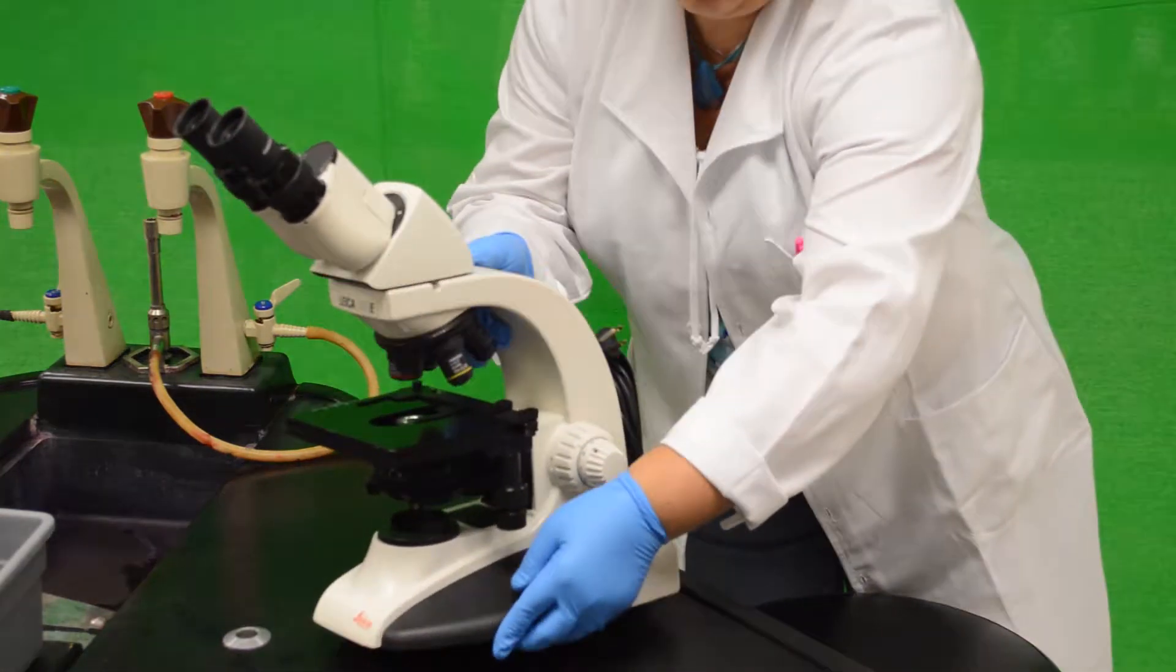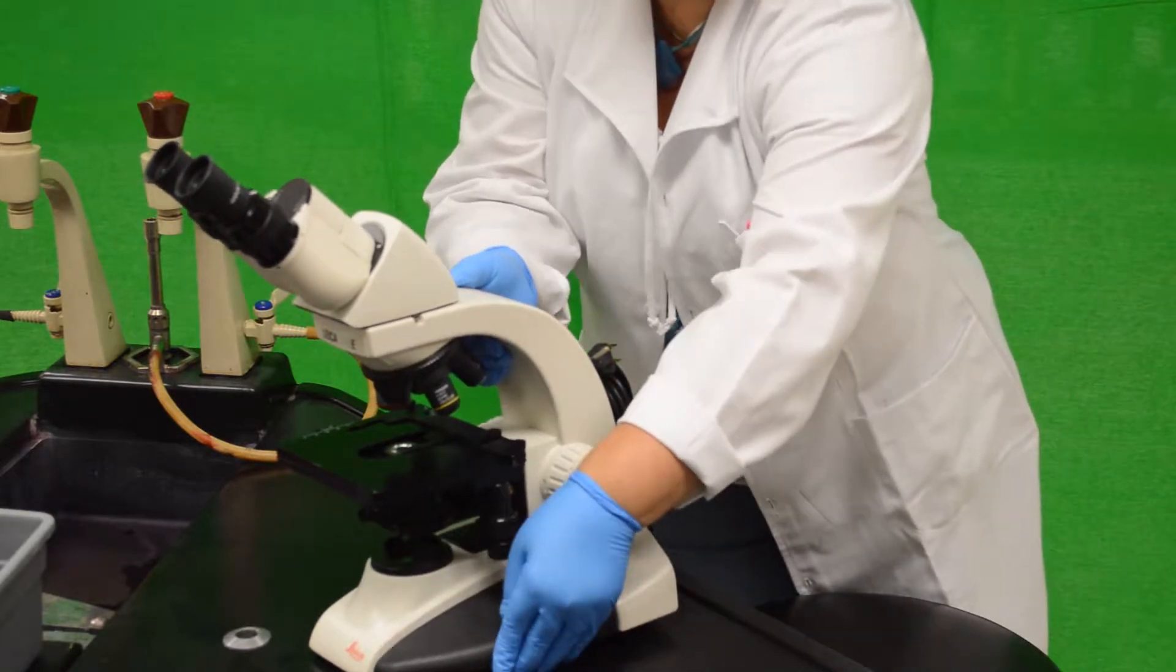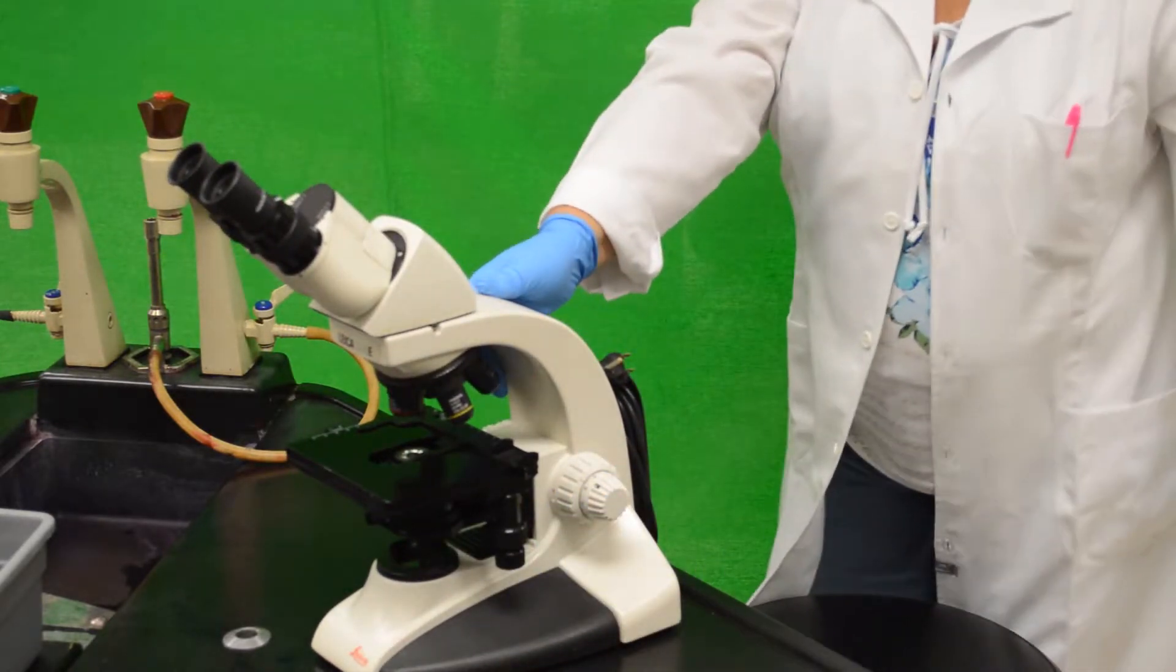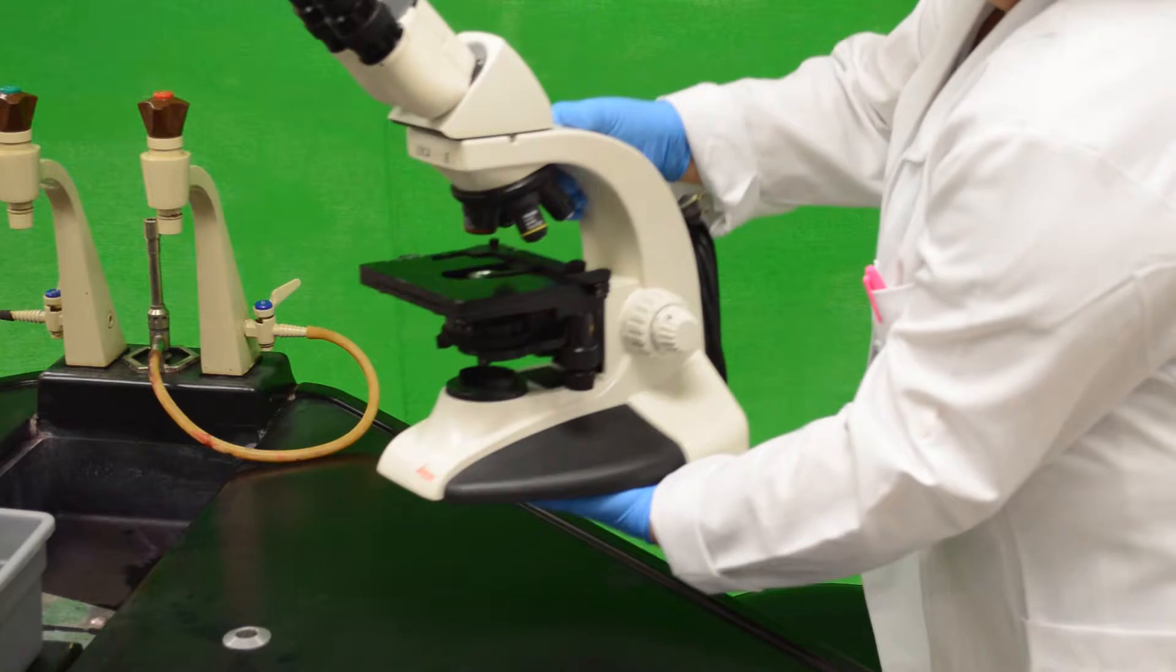Using a microscope is fairly easy as long as you follow some simple rules.